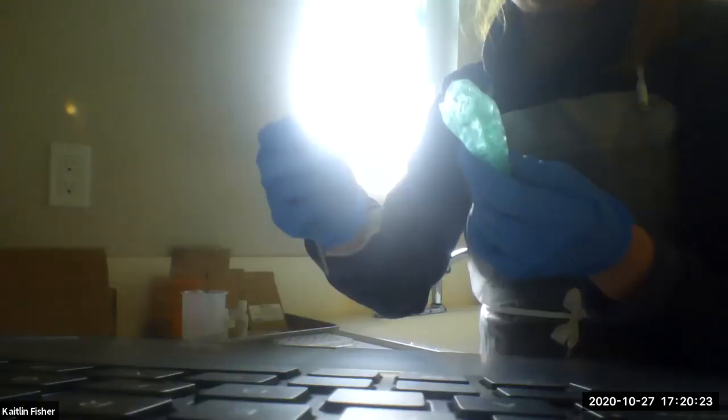One thing is to be very, very careful when you're opening this, because this glass stir rod is really fragile. What I did is use scissors and just cut the bubble wrap off, but just be really careful of this guy. It's quite fragile.